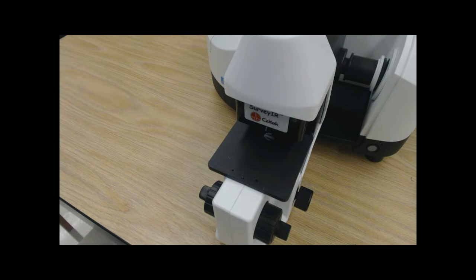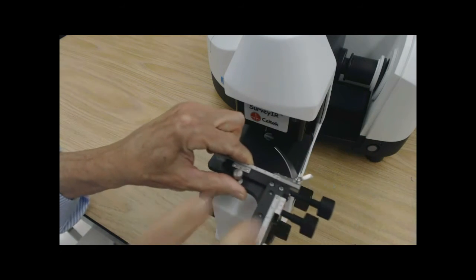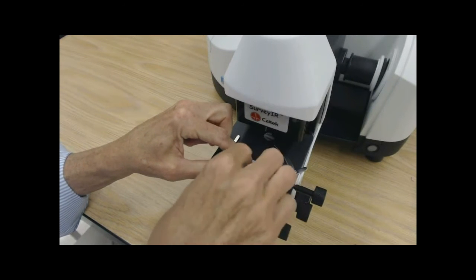Greg will now demonstrate the installation of the 1 by 3 inch slide clip and slide spacer.